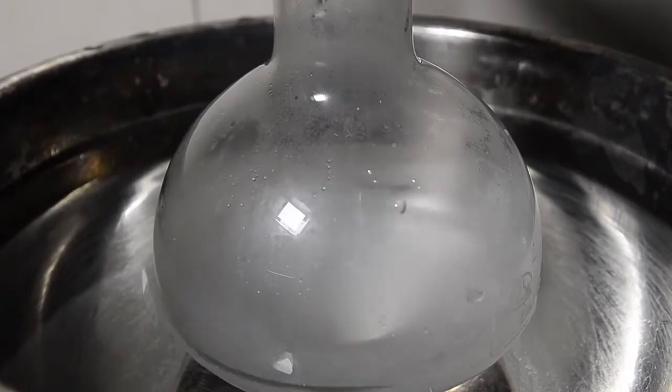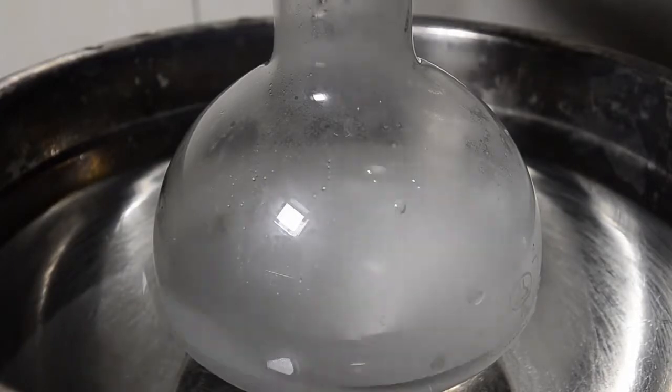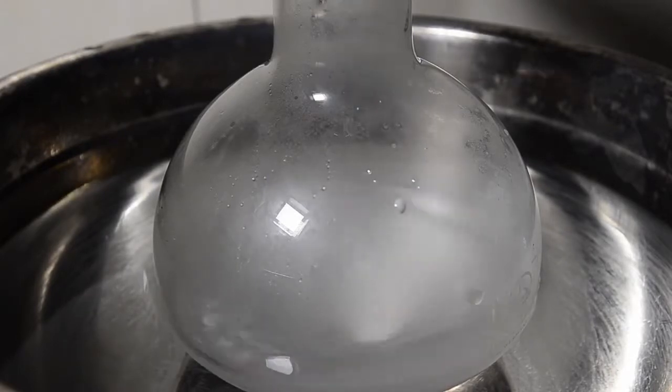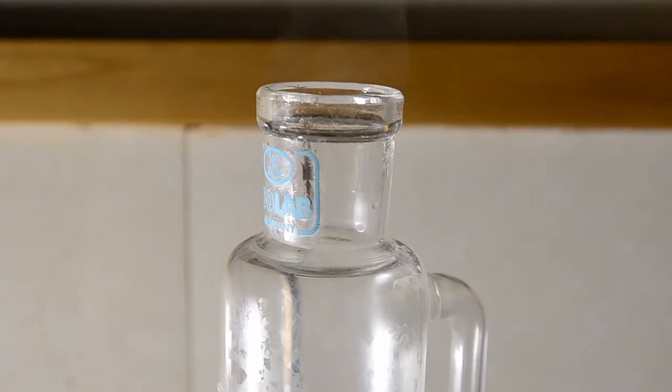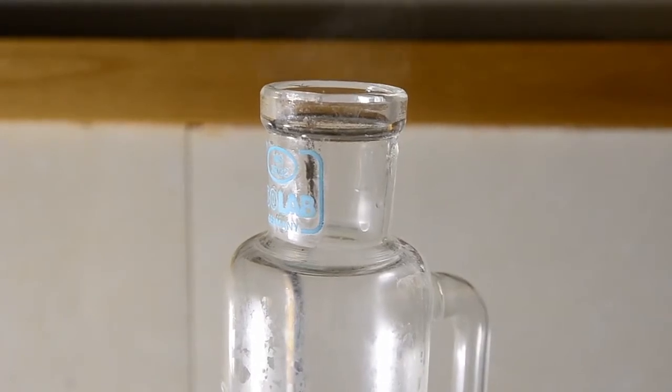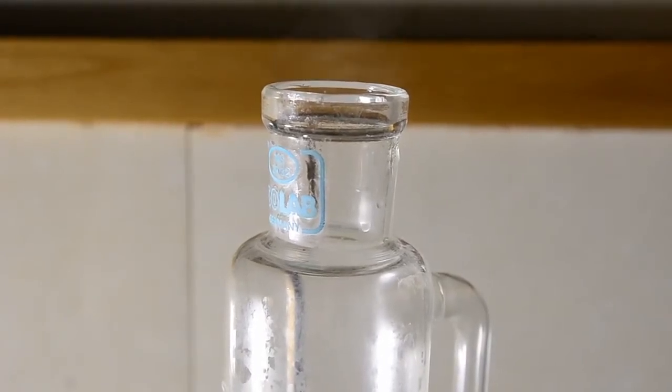Soon after you start adding you'll see a fog of HCl gas being produced in the flask and the contents will turn a milky color. This is our reaction taking place with the formation of the acid chloride. A lot of HCl gas will start to be produced and will escape the apparatus. Make sure you take care to vent this away properly.